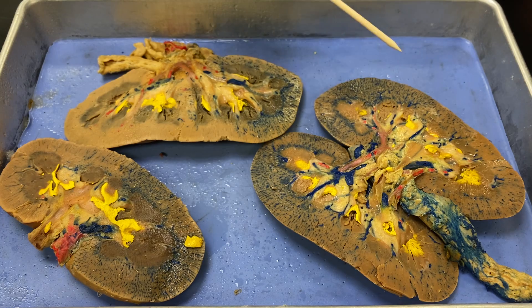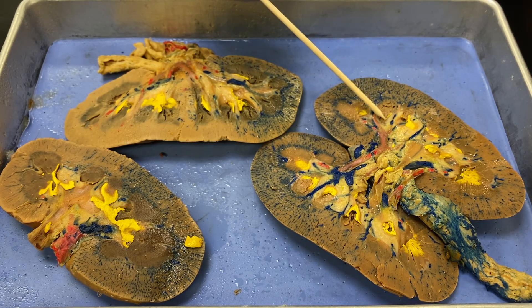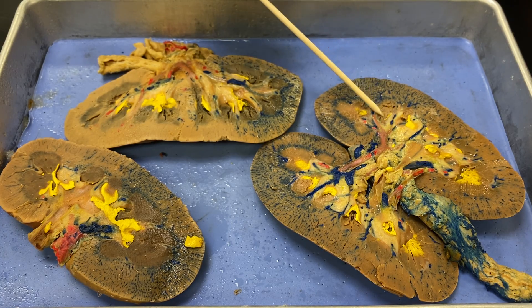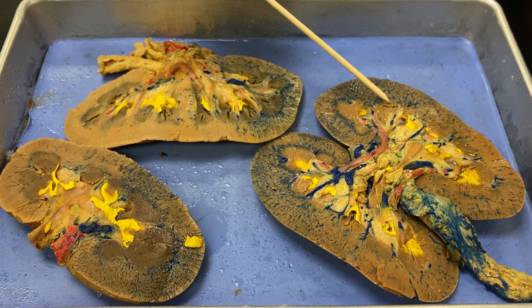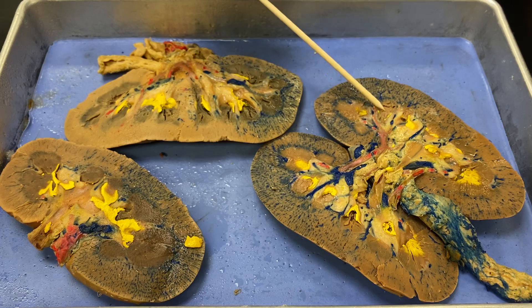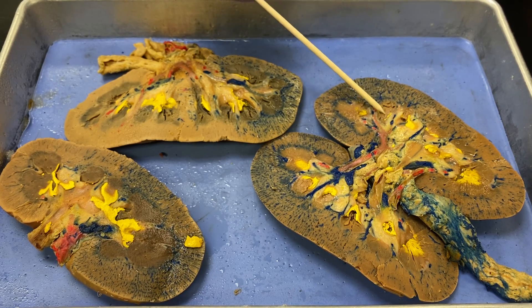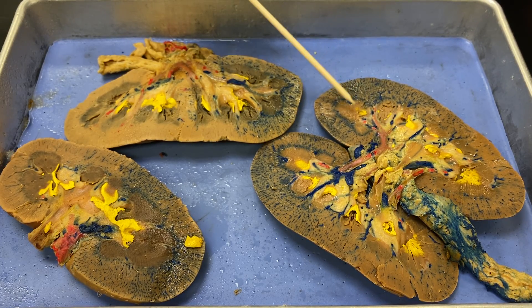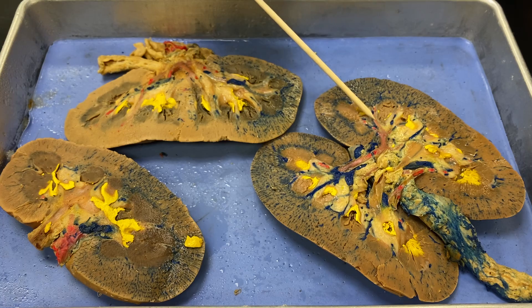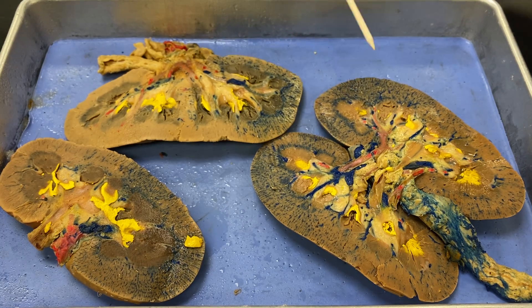And then this would be the medulla. In the medulla, you can see these little patches of dark brown. Those are the renal pyramids. That's one pyramid right there, and there's another pyramid right there, which means that the space between is a renal column.